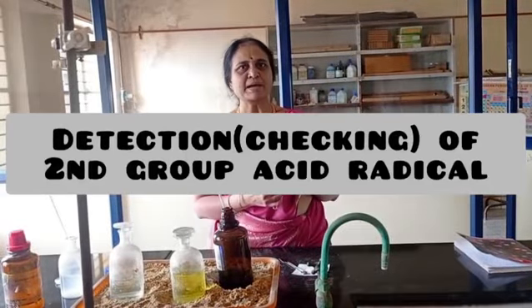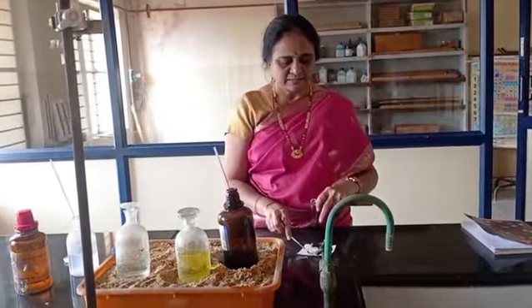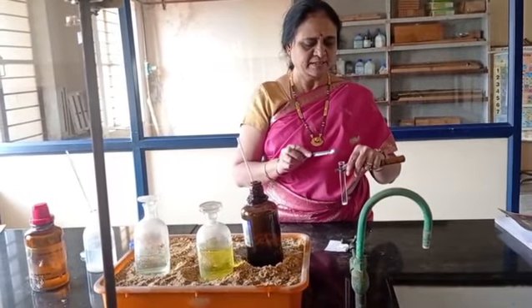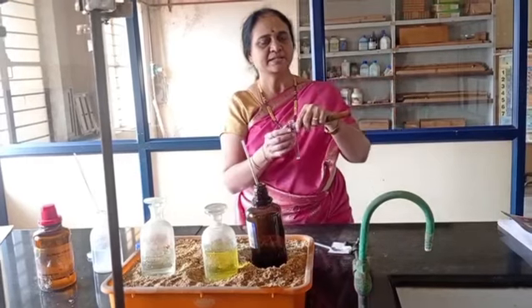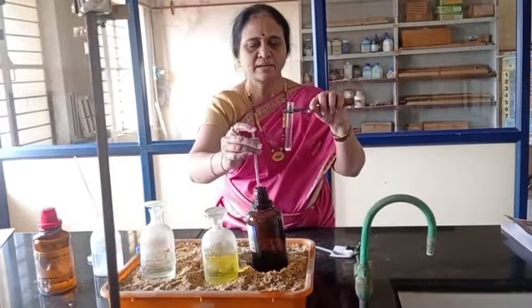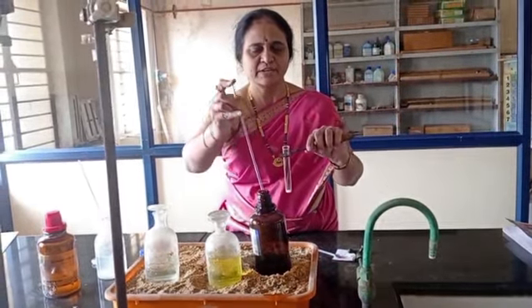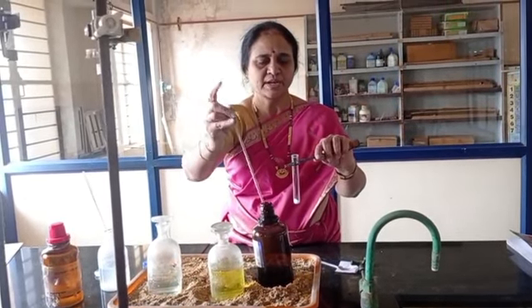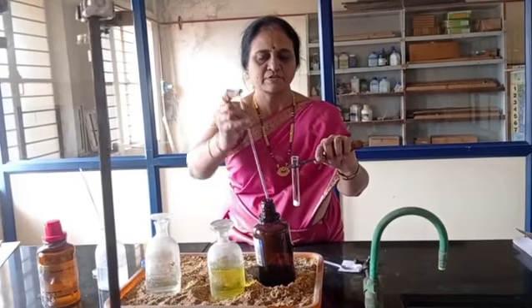Detection of second group acid radical. Take salt in a dry test tube, plus concentrated sulfuric acid. Salt in a dry test tube. Add concentrated sulfuric acid.